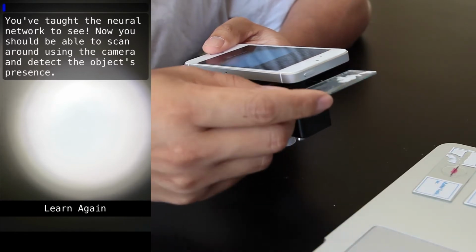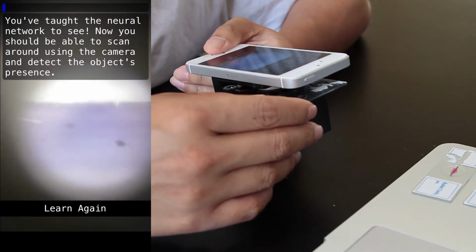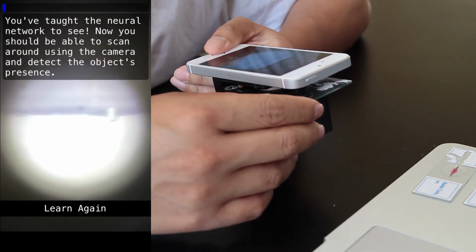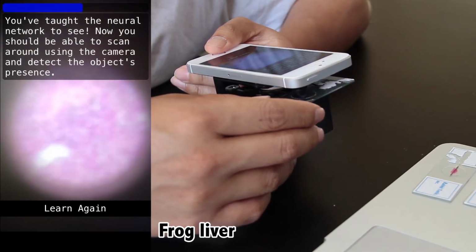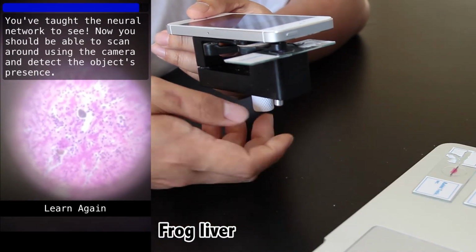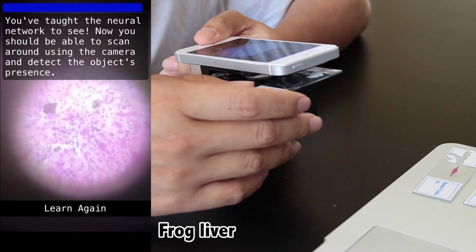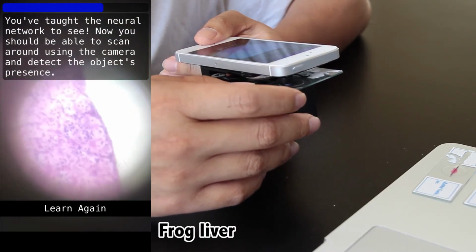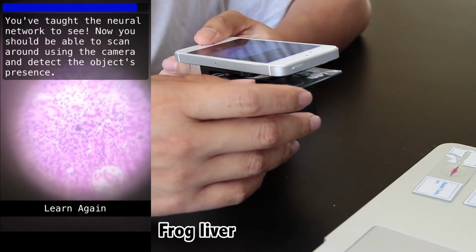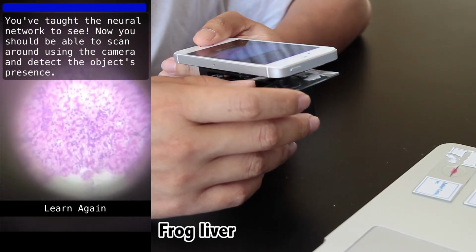Now that the training is done, let's see how well the algorithm does on the testing set, which is the bottom half of each section. How confident the algorithm is that it's looking at the frog liver that we showed it before is represented by the blue bar on the top left of the screen. And as you can see, it does a really good job. It's very confident that it's looking at the frog liver, even though the algorithm has never seen it before and can't do a one-to-one match. And you can tell it's only confident when I'm looking at the frog liver and pretty much any part of it.